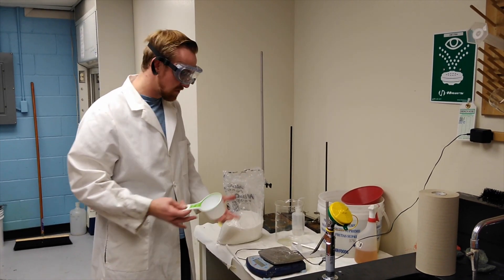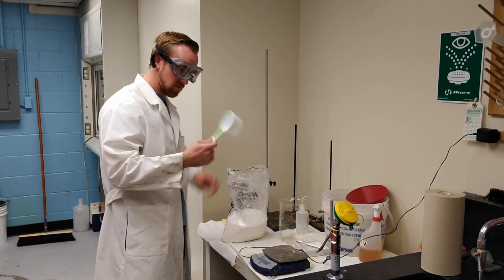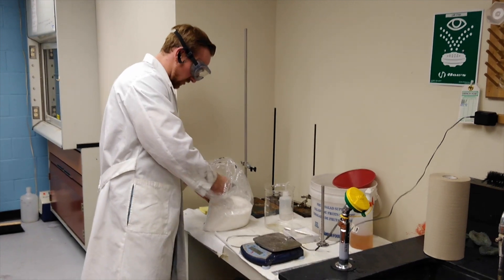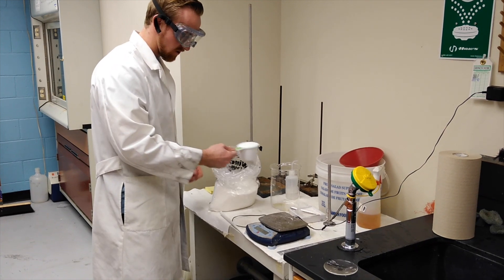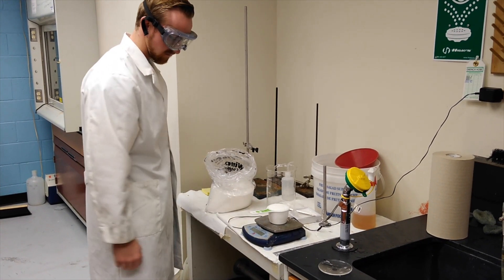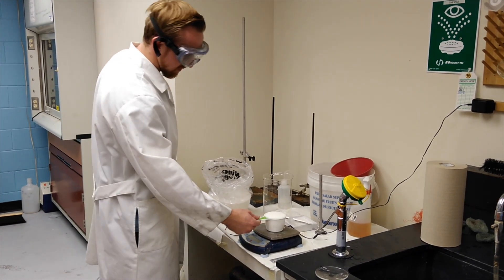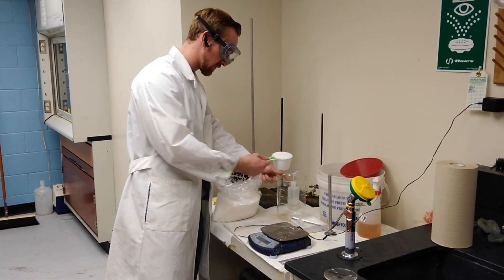Hello everyone, my name is Colin Meyer, and today we'll be showing you how to do the crystallization of sugar. So the first step is, you grab a one cup measuring cup, and you can take a scoop of regular table sugar, we bought ours from WinCo, and we're going to measure it on the scale. And we come to a mass of 226 grams, every cup of sugar, and we're going to put that into our massive beaker for our experiment.